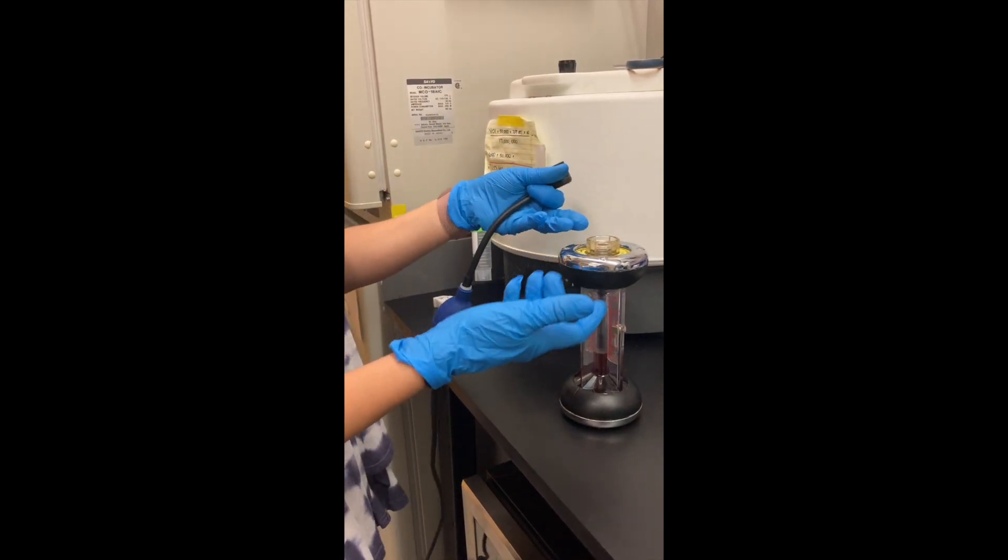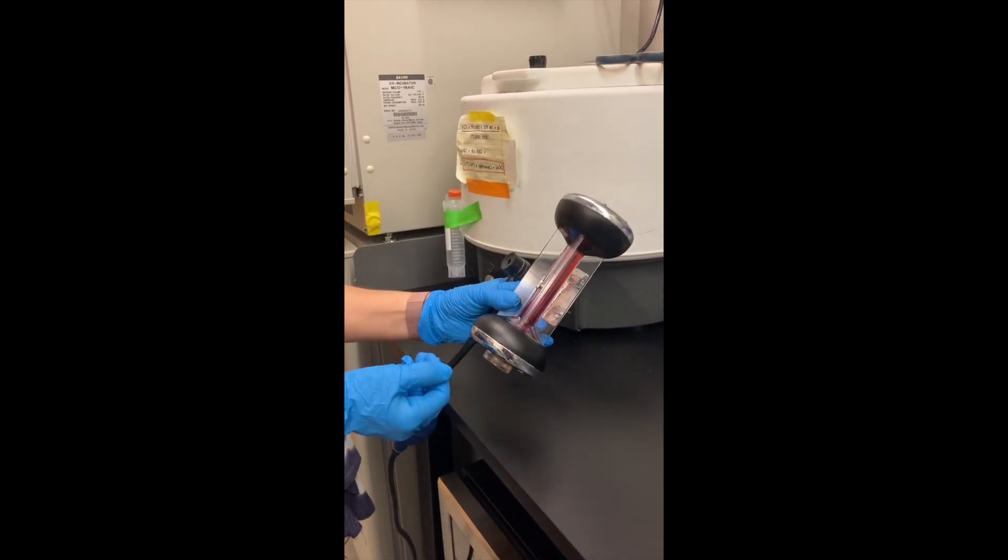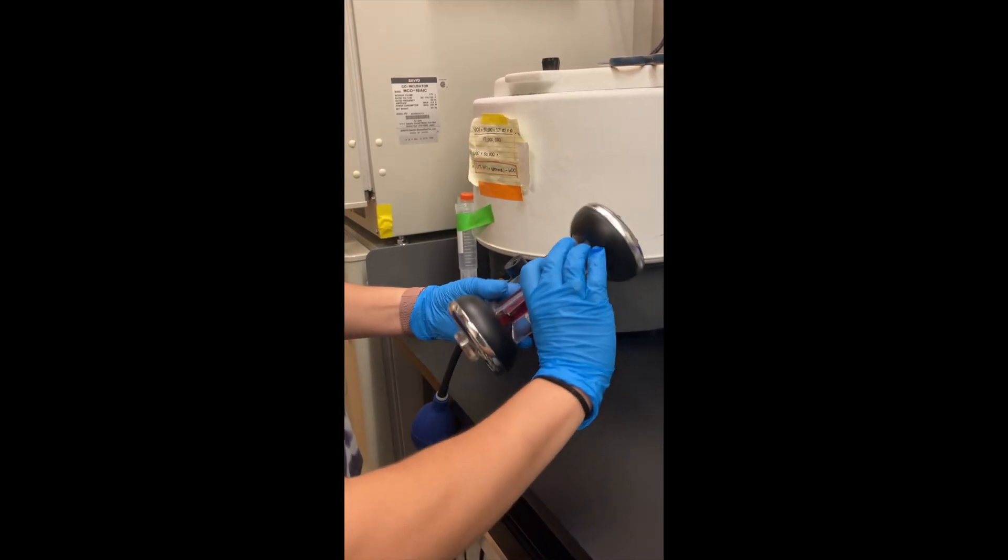So now the CO2 should be here, and then you flip it again to an angle of 45 degrees. Wait until it goes all the way up, and then you flip it back.